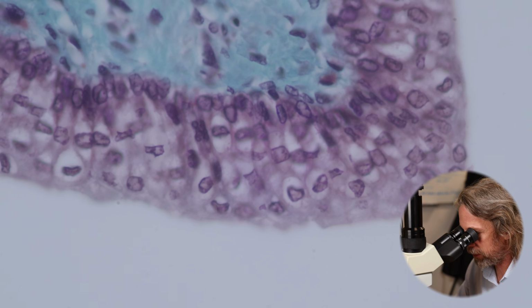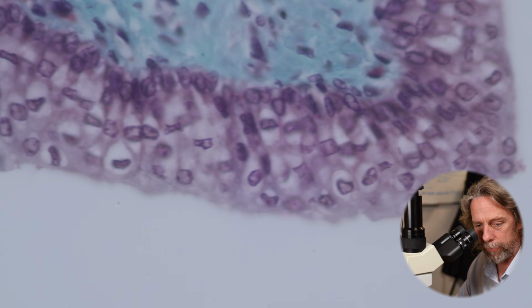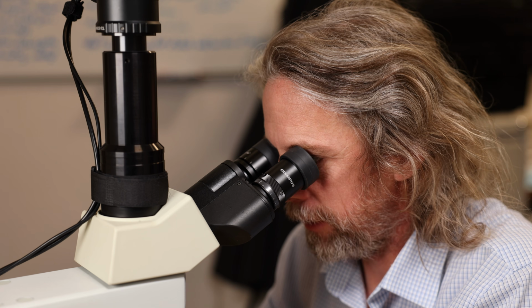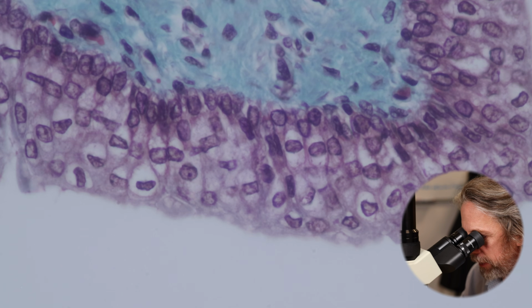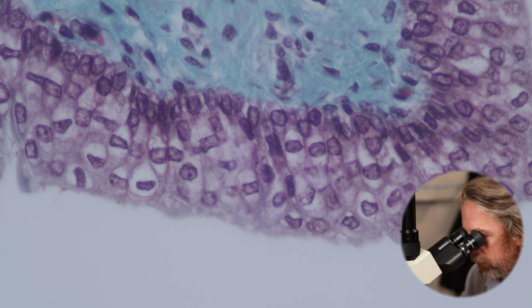Right. So there's our urothelium. This is an epithelium, a form of epithelium. Now these cells in the urothelium, we've got multiple layers of cells. So this is a stratified epithelium, and the cells in the different layers are slightly different shapes. The cells closest to the green, closest to the lamina propria, where there's a basement membrane, those are the stem cells that will keep replacing the cells closest to the lumen that get lost.